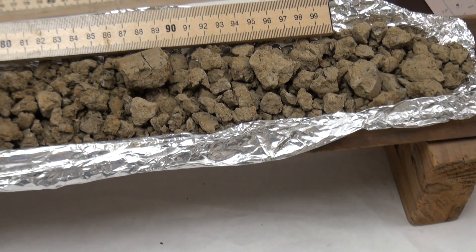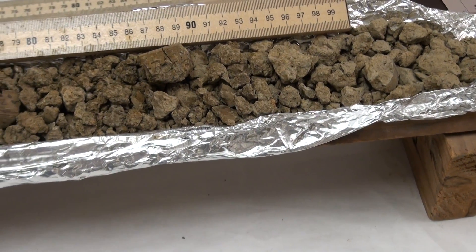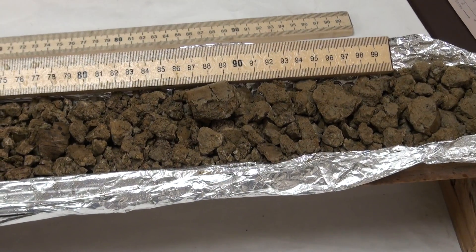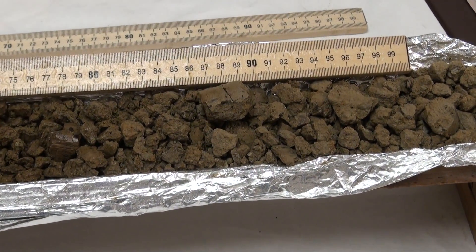Let's spray a little water on here, starting at the bottom. When you wet things down, wet soil is a little darker — it's absorbing more light. So as we go and wet that down, that's exactly what happens.